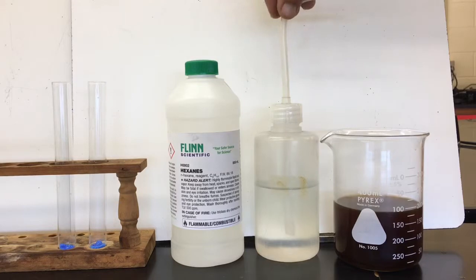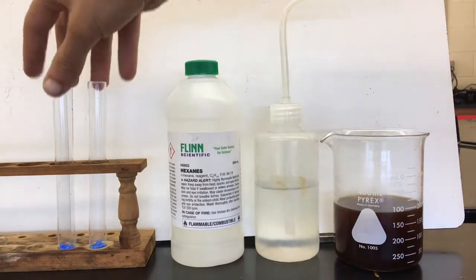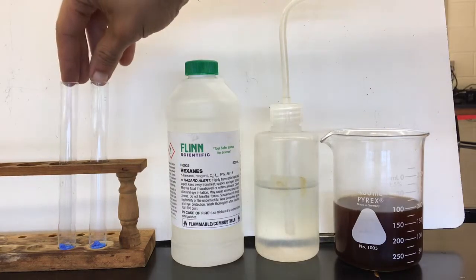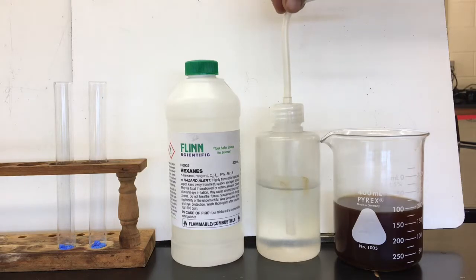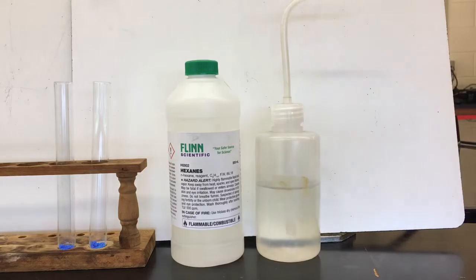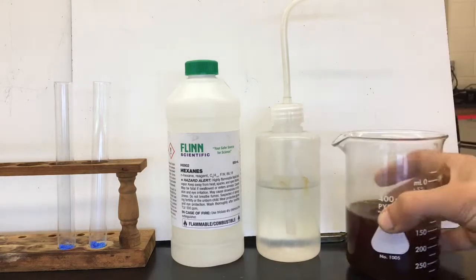Here we've got our hexanes, we've got some water, we've got coffee, and two samples of copper nitrate. We're going to test the solubility of the copper nitrate in both hexanes and water. And the coffee here is just for me to drink. Mmm, yummy!